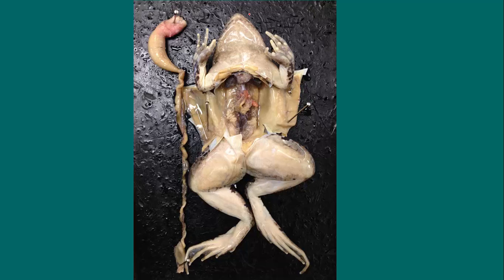If we start from the mouth of the frog and go down to approximately the cloacal opening, you could estimate that this digestive system is about 1.5 body lengths of the frog. So if this is 1 body length from here to here, this is 1 body length in the digestive system, and then this bit is approximately maybe another half of that again. So the frog's digestive system is approximately 1.5 body lengths. And this is just a way that we can compare the frog to the rat when we look at the rat.